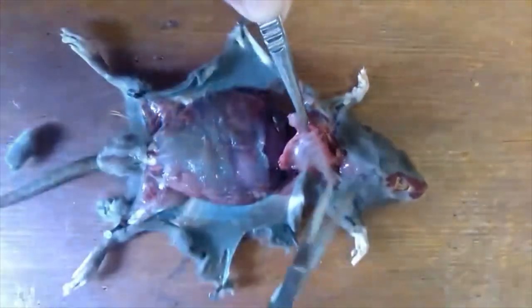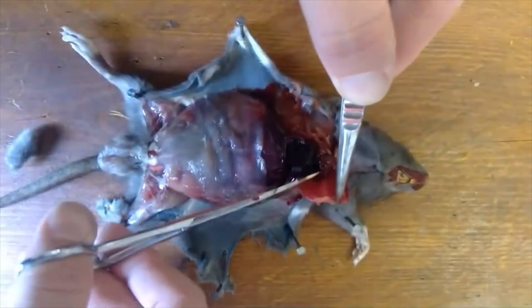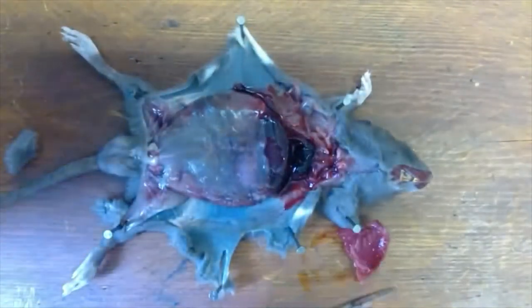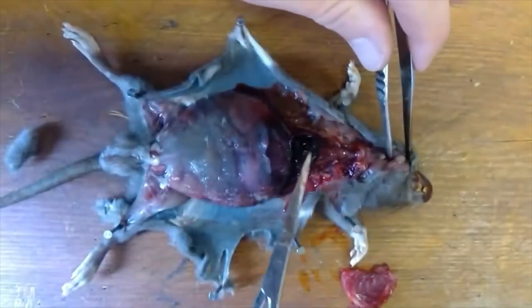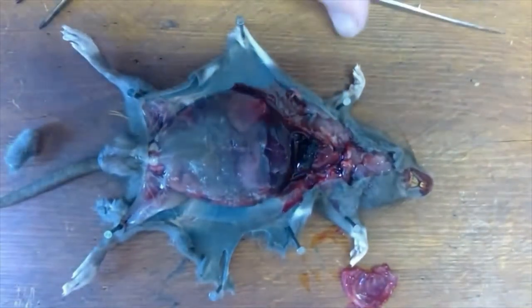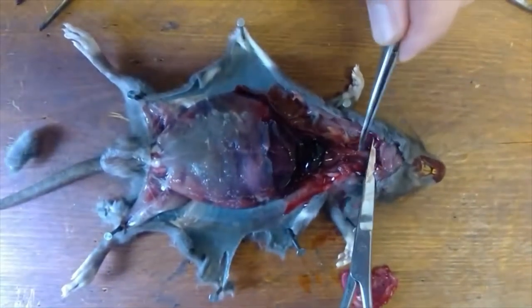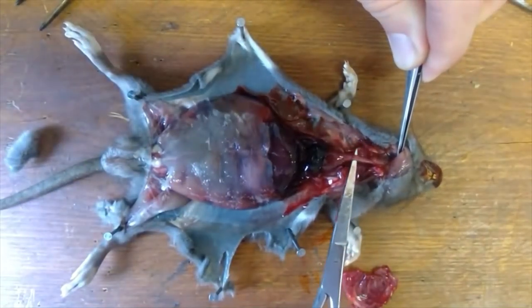Just working away up, always trying to be delicate — I don't want to damage the organs below. We've now exposed the organs within the thoracic cavity quite nicely. That's the heart there; the lungs — that's one of the lobed lungs there, and here's another bit of lung at the top. We'll now try and find the trachea and work in from there. Hopefully you can see this tube here — that is the trachea.